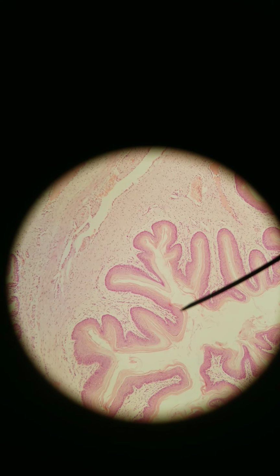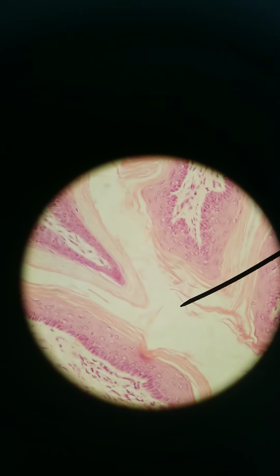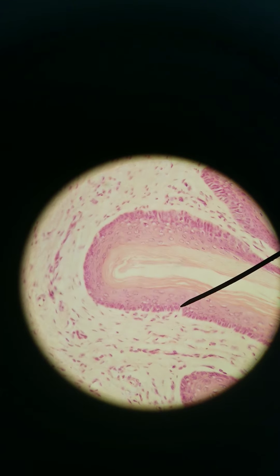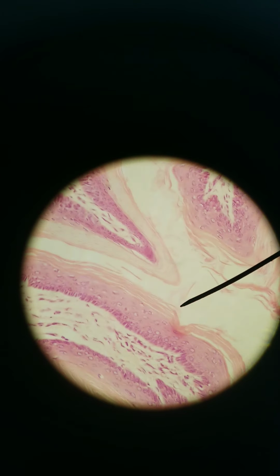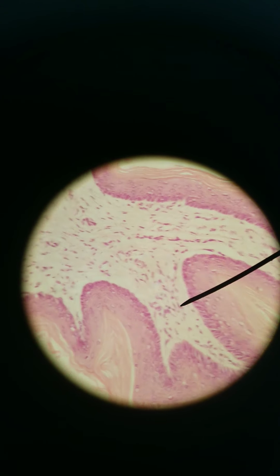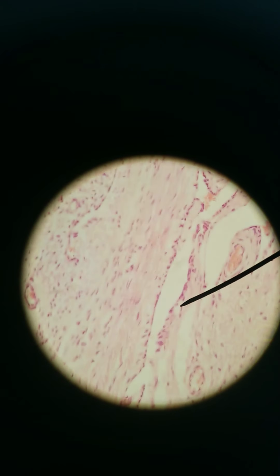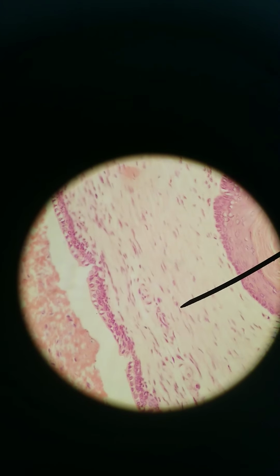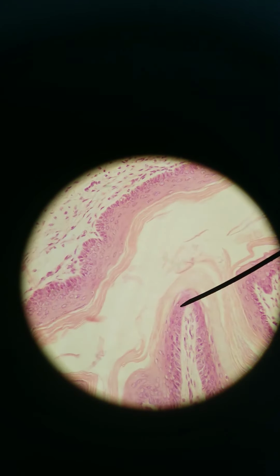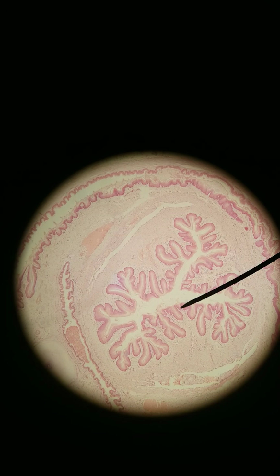So that's 100x. There is 400x. You can see the layers here. The layers are a lot more even than before. Nice even stratifications. Areolar connective tissue deep to that. And a small layer of smooth muscle. You can see the smooth muscle lining around here. That's a urethra, and we all urinate out of our urethras. Just some people have penises and some people have openings to the vulva.